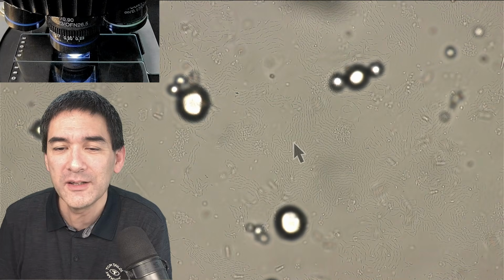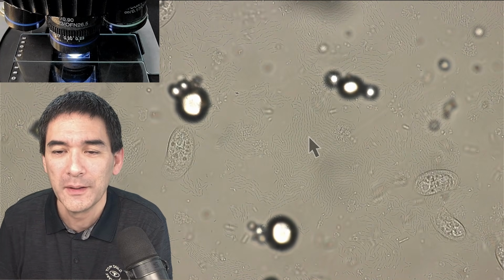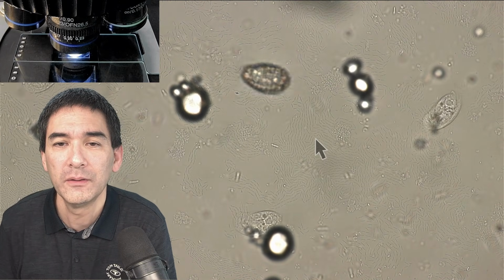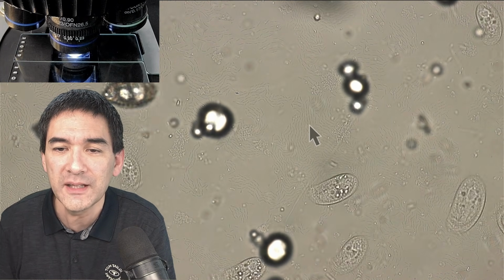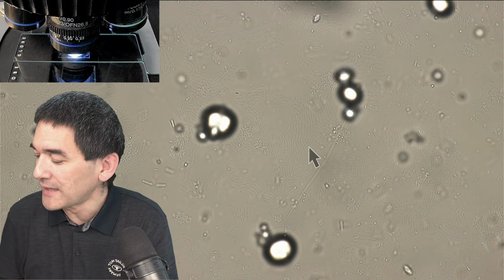Do you see those lines here in the background? This pattern? Well, these are also bacteria. But these bacteria are sticking to the surface of the slide or the cover glass. So when I made the sample, it was maybe a colony in the water sample, and they were pressed apart, and now they're sticking on the surface. So you see that the contrast is kind of low.